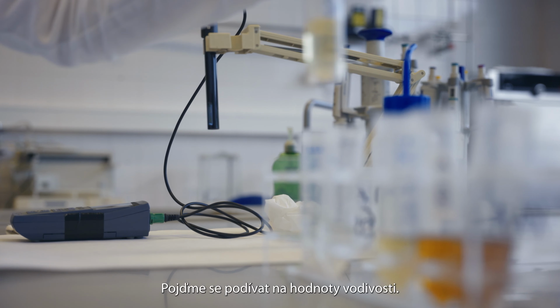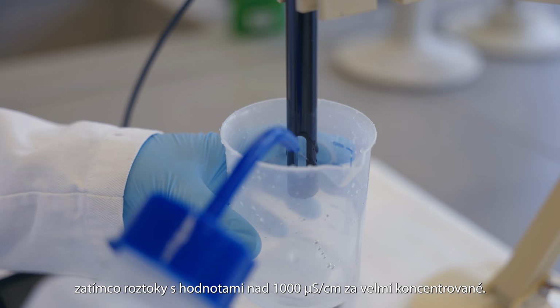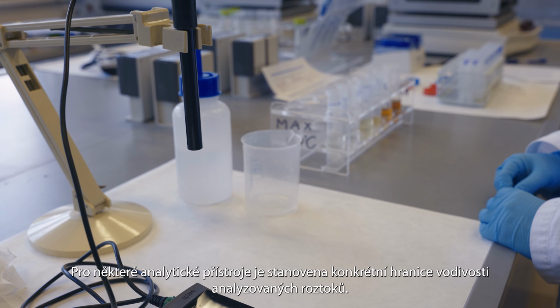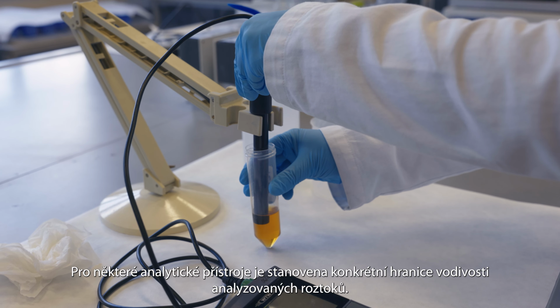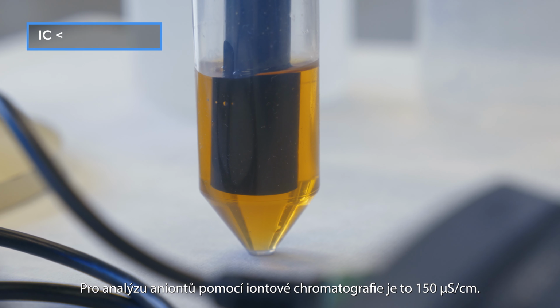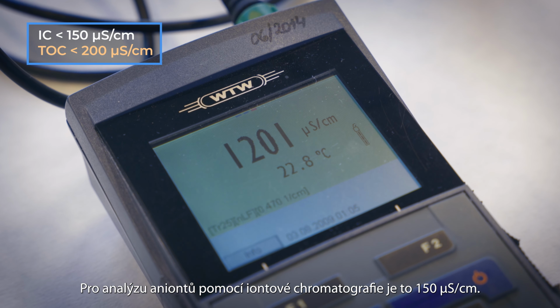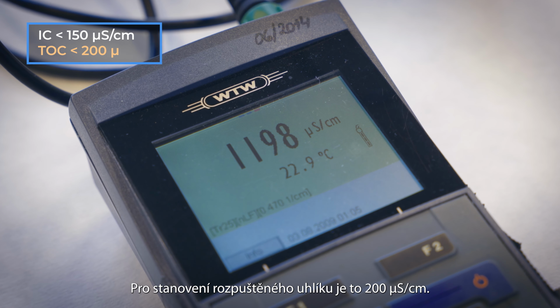Let's have a look at the conductivity levels. In general, solutions with conductivity values up to 100 microsiemens per centimeter can be considered as low concentrated, while solutions with values above 1000 microsiemens per centimeter can be considered as very concentrated. For some analytical instruments, a specific conductivity limit is set for the solutions to be analyzed. For the anion analysis using ionic chromatography, it is 150 microsiemens per centimeter. For the dissolved carbon determination, it is 200 microsiemens per centimeter.